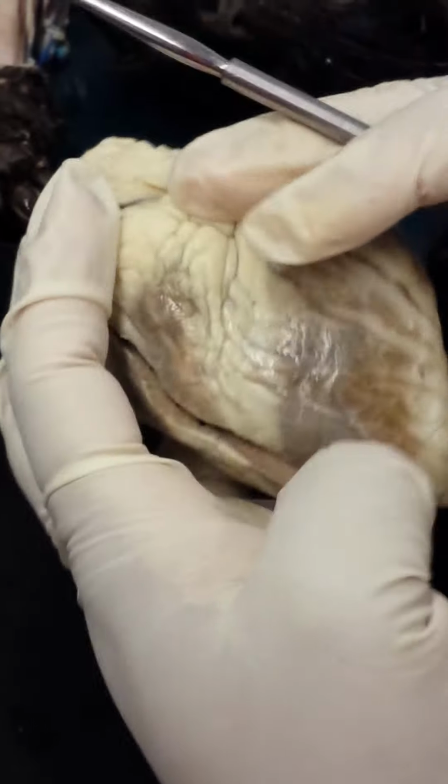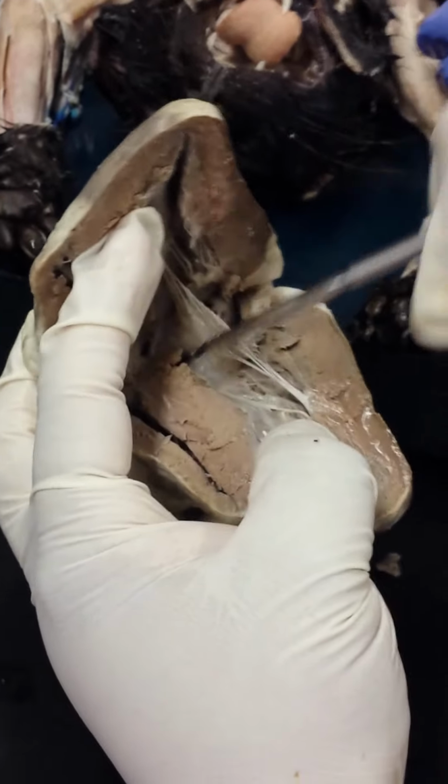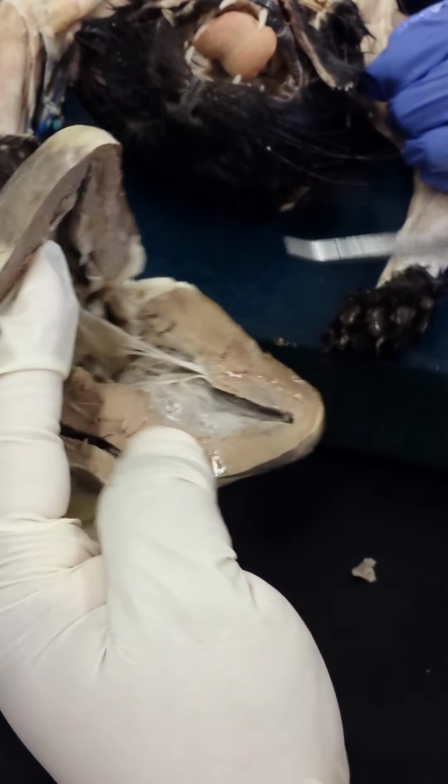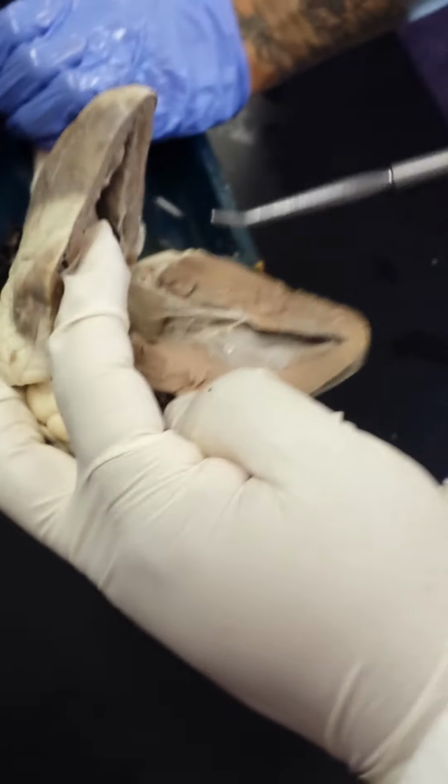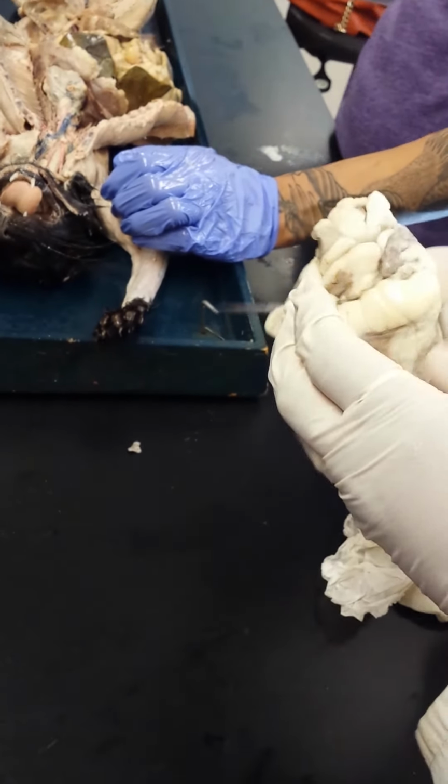The ones that you see clearly from inside, the internal anatomy, are the aortic. And then just pay attention again to where the probe is coming from and what ventricle you're in, and then you can determine that as well. That's the heart.